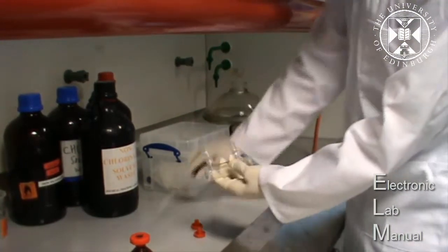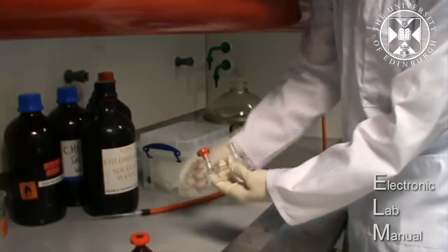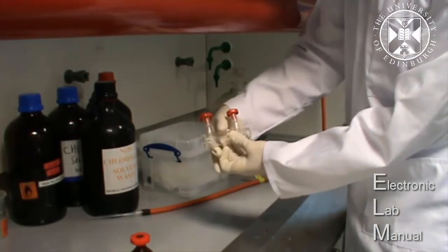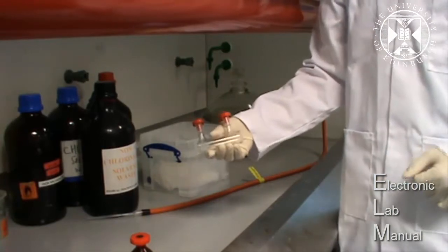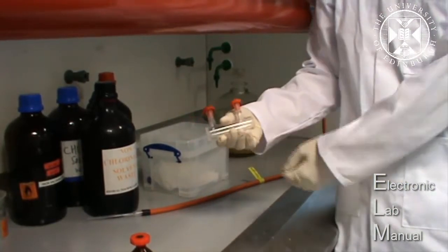So once you say that's enough of the nitrogen, place the Teflon lids back on the cell and then run the background on the spectrometer with the conditions set in lab.